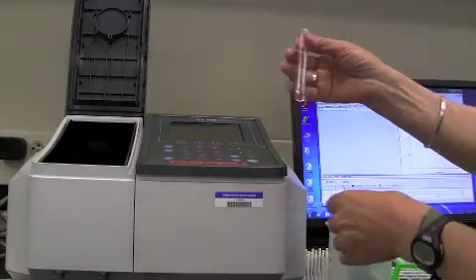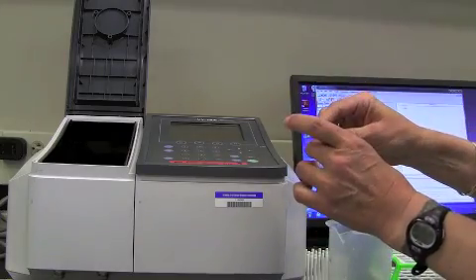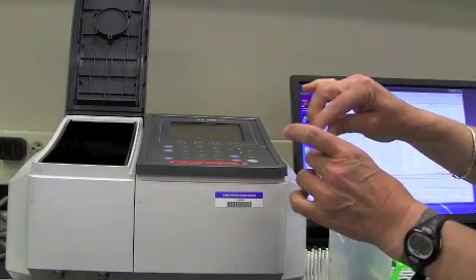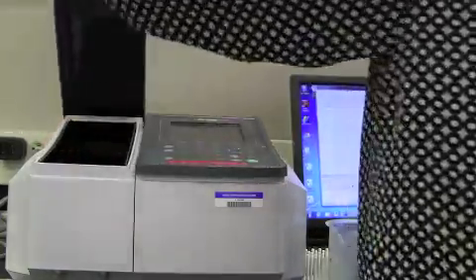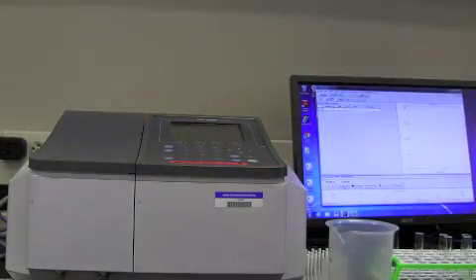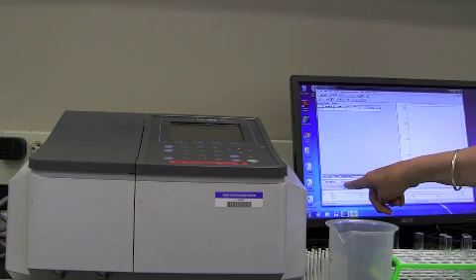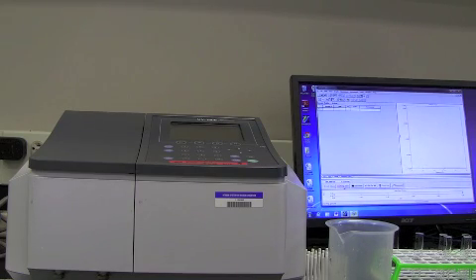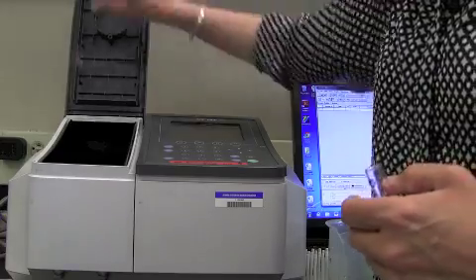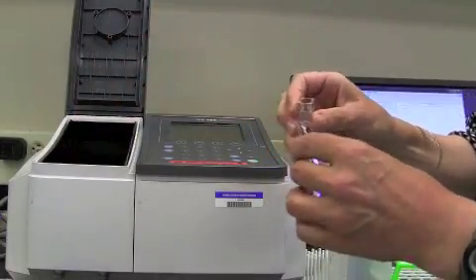So to do that, we start with our 10. Just pour it into the empty cuvette. Put it into the front of the spectrophotometer, close the lid, and there's a window here, and this is reading the absorbance of this sample is 0.239. And I'm going to write that down on the table that I use for the pipetting, so 0.239. We'll then take this sample out, and you can pour it back into the tube.